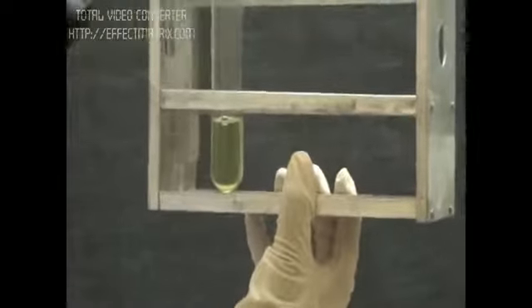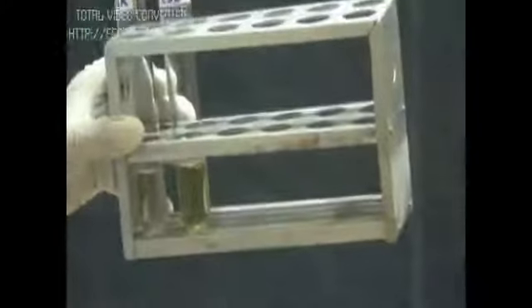Now we can see after adding NaOH, the basic condition has given the color. The PNP has a yellowish color. We can see the blank is colorless and the test has yellowish color because it has the enzyme which converted our substrate PNPP to PNP.